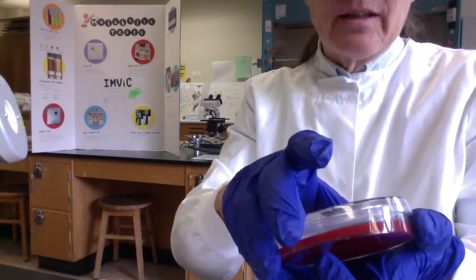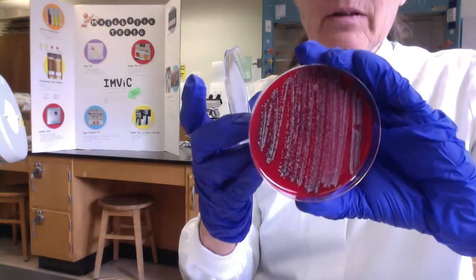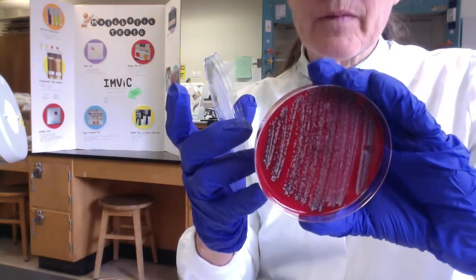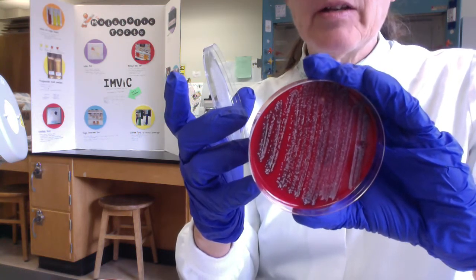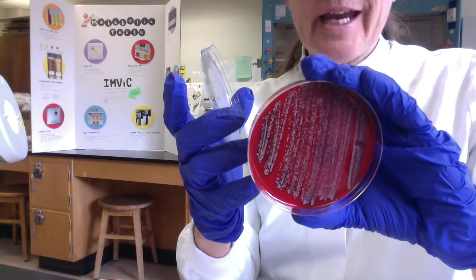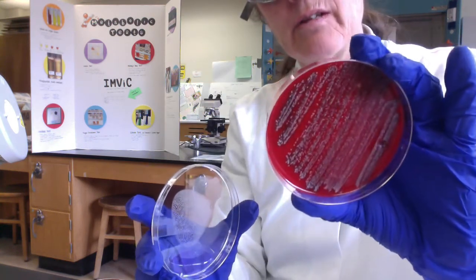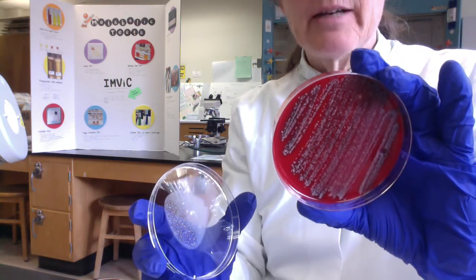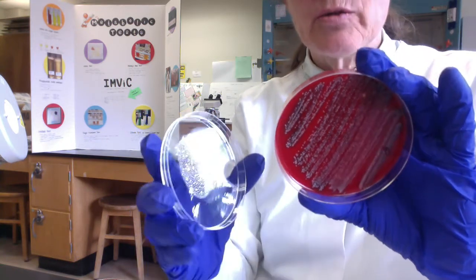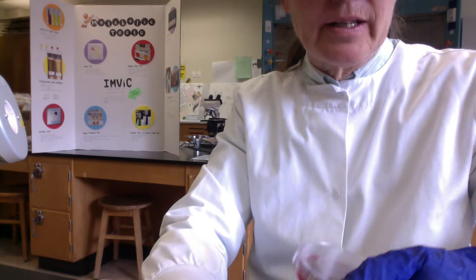And folks, I'm going to take the lid off because there's condensation on it, but you can see there's a variety of different little colonies in there. Our mouths, our throats have more than one type of microbe in there. Some of these little colonies are gamma hemolytic, meaning that there's no hemolysis at all. What I was interested in was seeing if there were any beta hemolytic colonies, because that would be suspect either Strep pyogenes, or another one that I've actually recovered from my throat is Staphylococcus aureus.